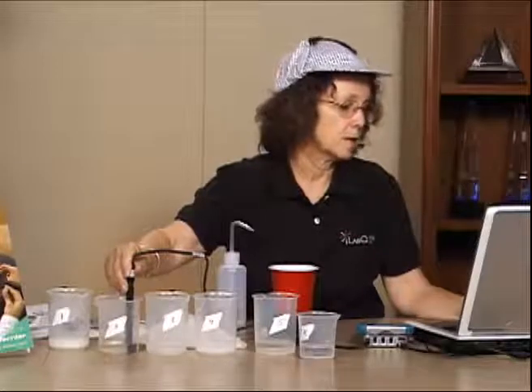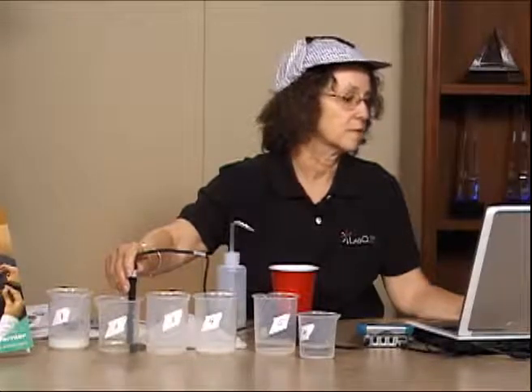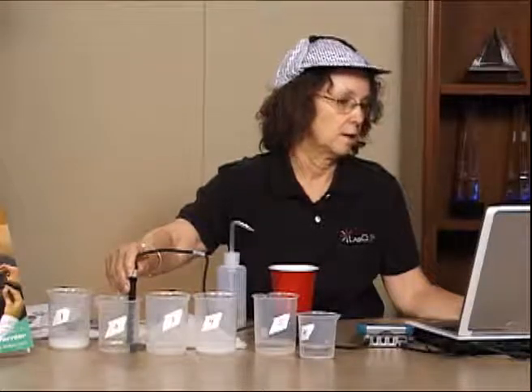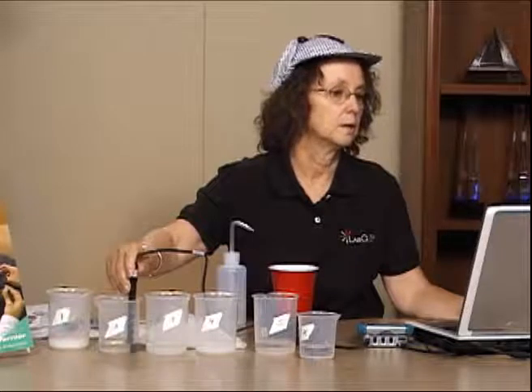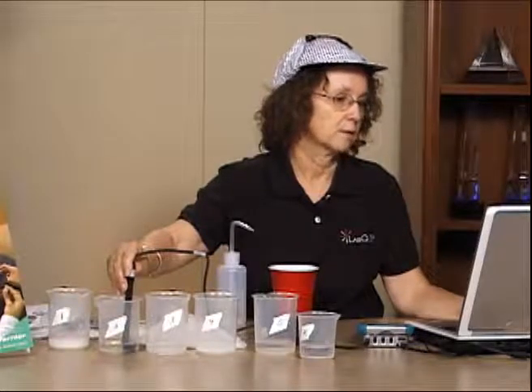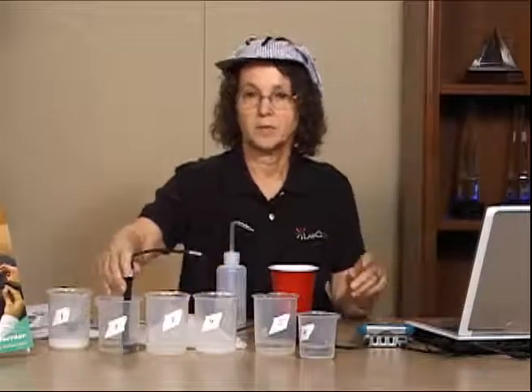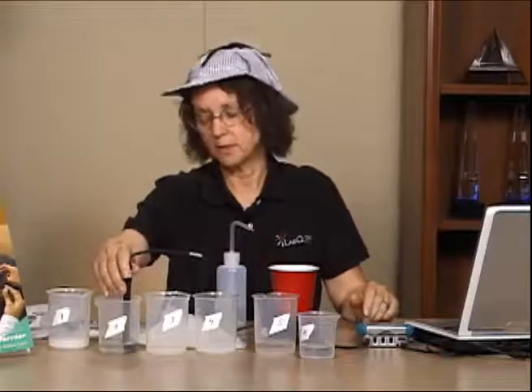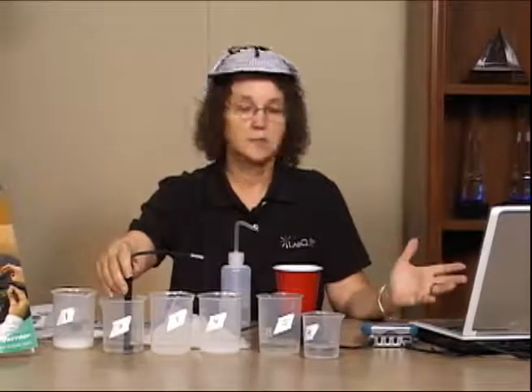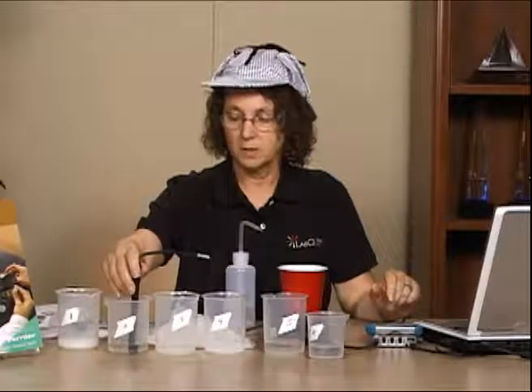Depending upon the group of kids, I sometimes number them 1, 2, 3, 4, but I sometimes give them drug names. If it turns out to be one of the drugs that are actually drugs, like cocaine, as opposed to aspirin, then that means the person should be proven guilty and have additional drug charges waged against him. If it turns out to be aspirin, or something that's not a drug, then obviously the man is innocent.